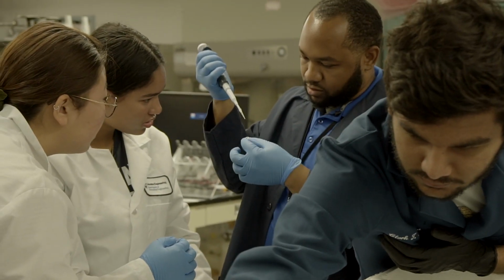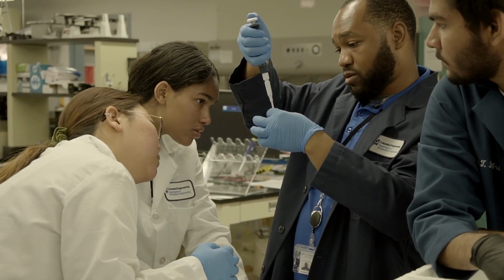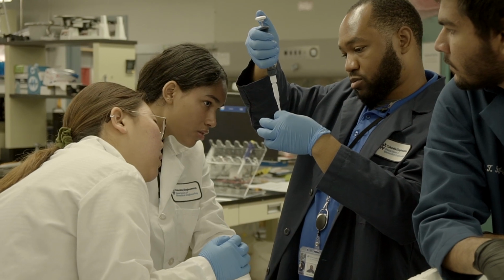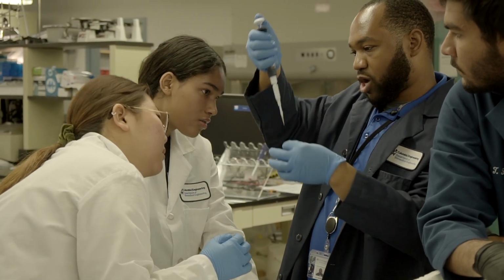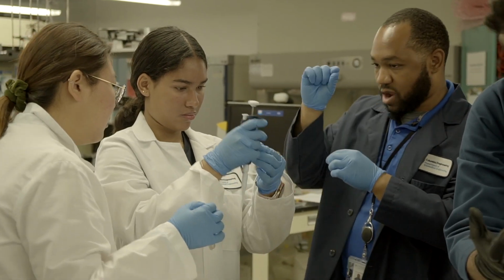You're still missing it. So make sure you're all the way in the liquid. Go to the bottom of it and slowly come up. Okay? So for groups, go to the very bottom of the tube and come up slowly. You should be able to see it right.